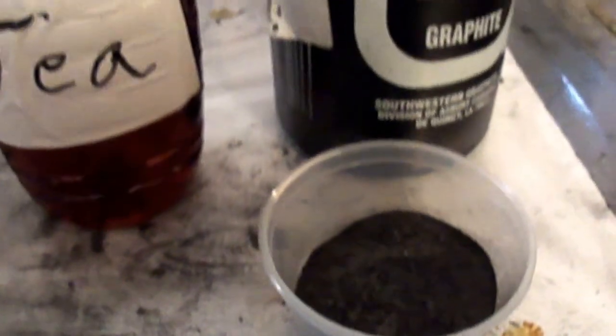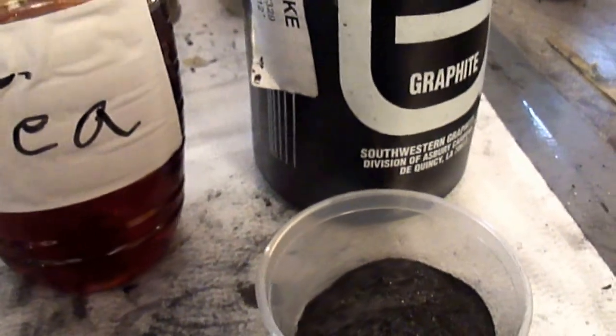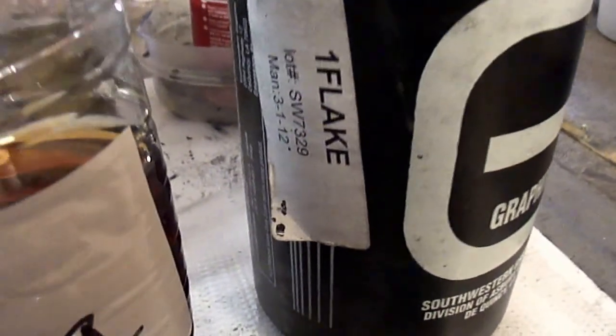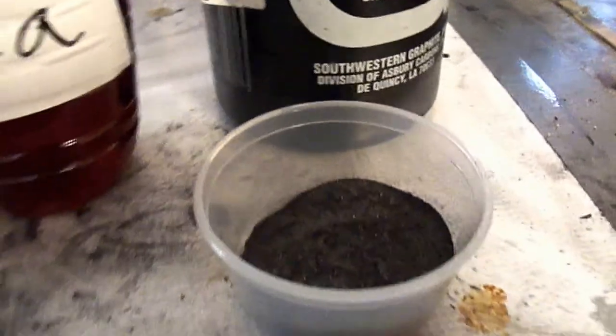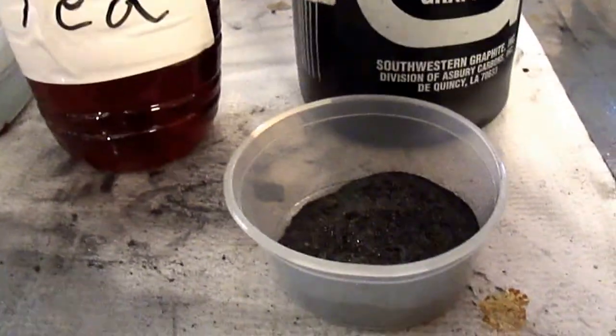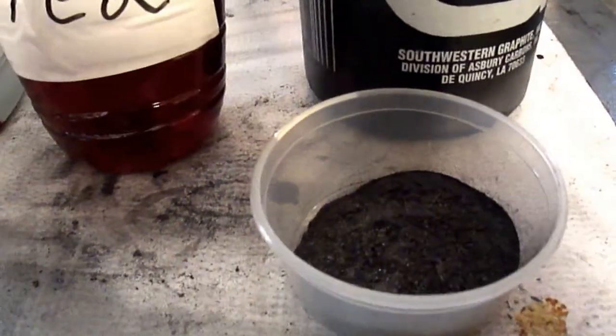Let's see how we did this. First of all, I take the large flake graphite, number one graphite, which is high grade carbon.